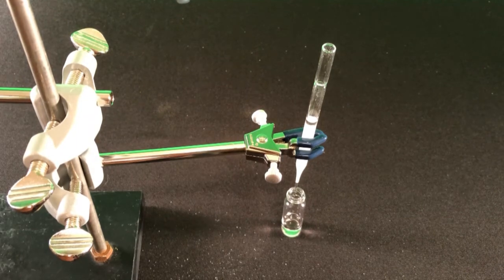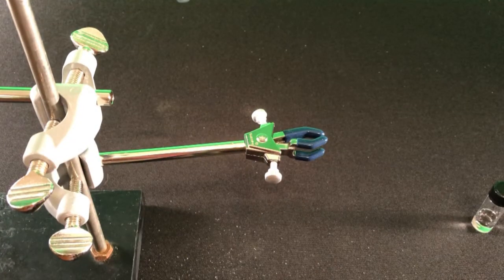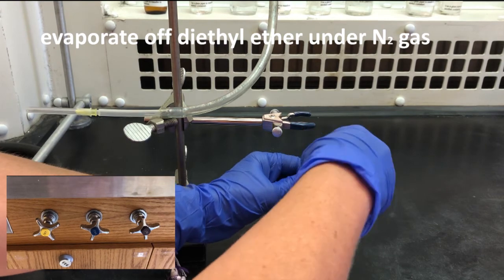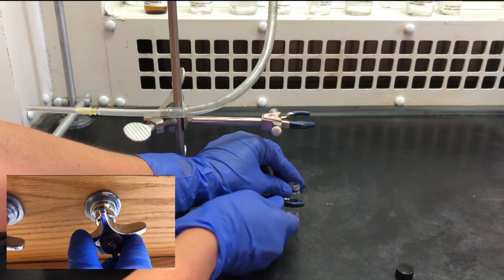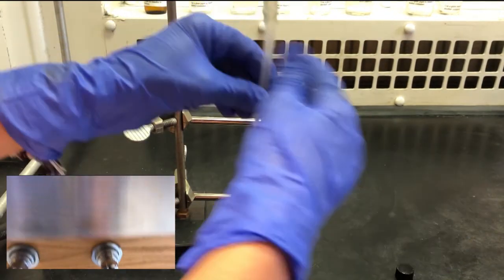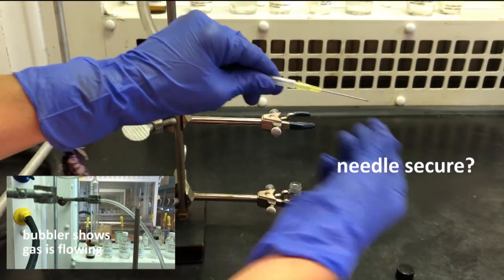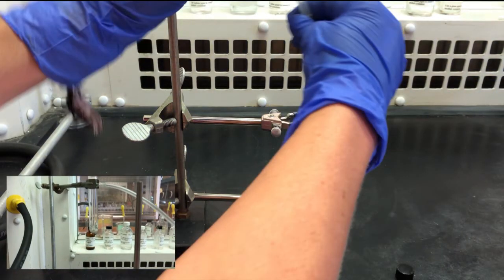To obtain the crude product, remember that some starting material may be present, so it's likely not 100% pure. Evaporate off the diethyl ether under a gentle flow of nitrogen gas. Make sure that the needle is secure in the tubing and that the gas is not turned up too high. Turn on the gas first before placing the needle above the surface of the solvent. Check the flow by carefully feeling the breeze against your forearm. Do not stick yourself. Secure the nitrogen line above the vial.